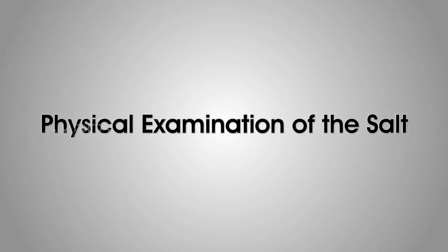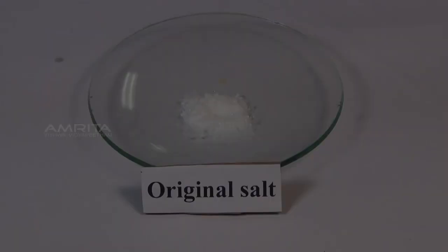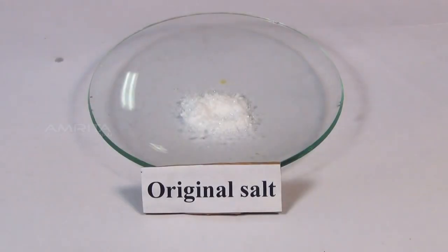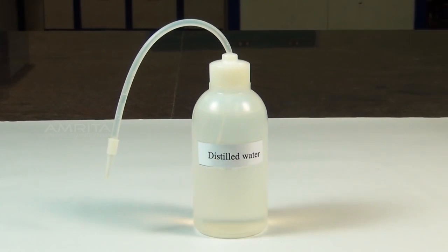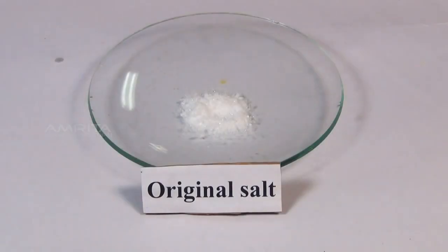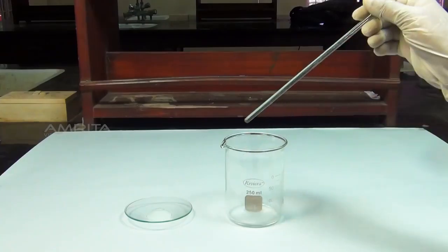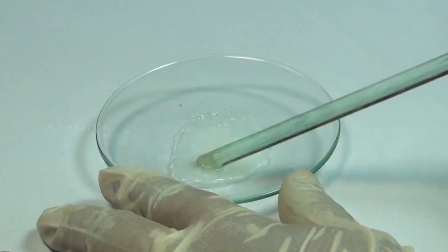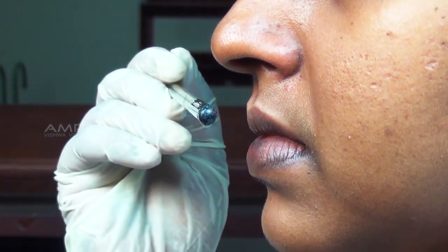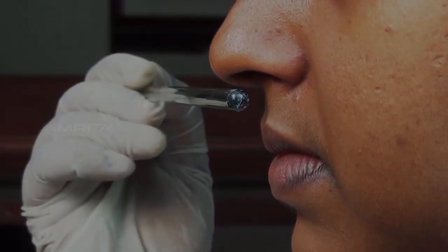Physical examination of the salt. Materials required: a small quantity of the salt in a watch glass, distilled water and glass rod. Procedure: take a pinch of the salt in a watch glass. To this, add a few drops of distilled water. Now, take the glass rod and rub the salt with it and smell it. A vinegar-like smell indicates the presence of acetate.